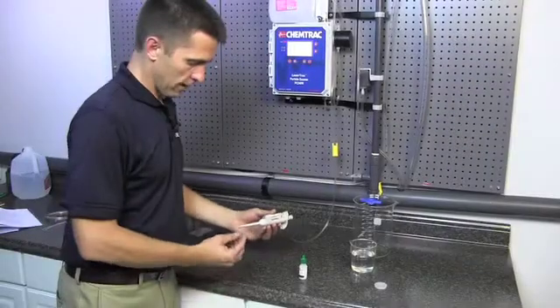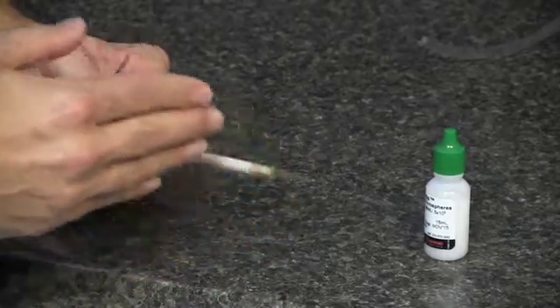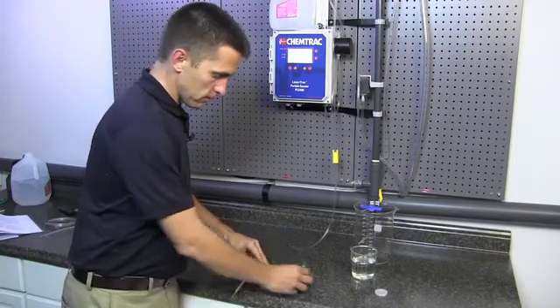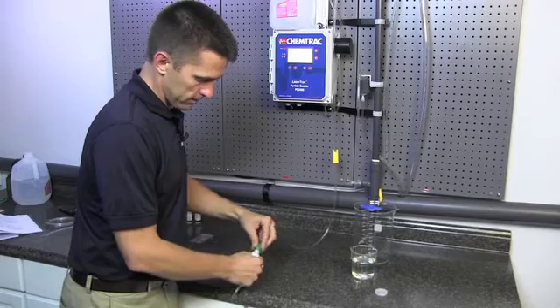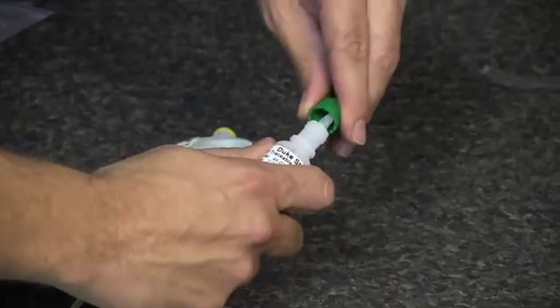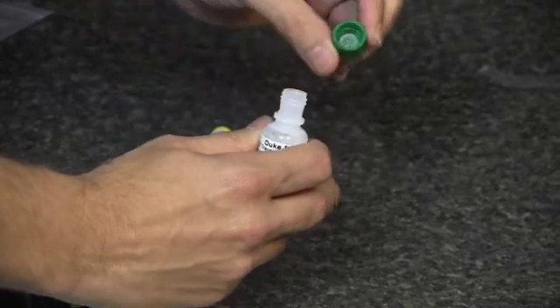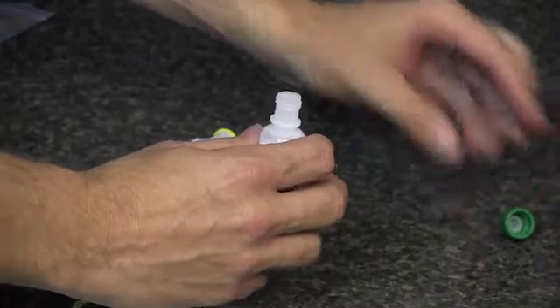So we're going to attach our clean pipette tip to the end of the pipette. If you think this might be dirty, you can definitely rinse this with the flush water. And then we're going to take our bottle of spheres, unscrew the green top. And we're going to use the green top to kind of leverage off the eyedropper tip. So that opens up the bottle for us.